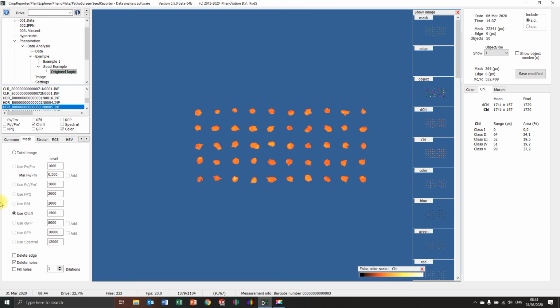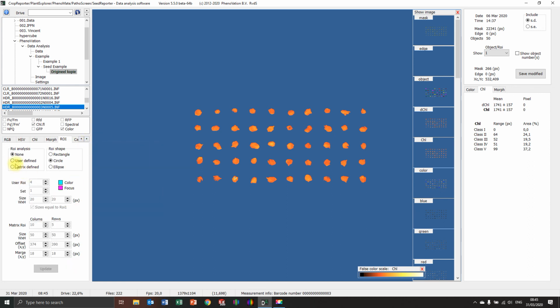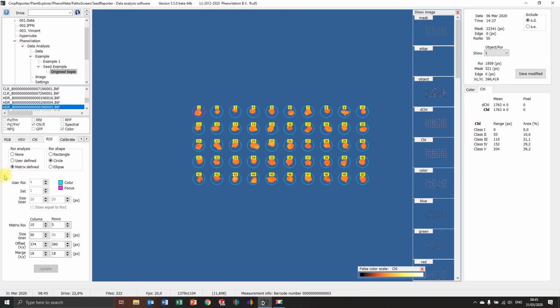So important when you do the analysis, always put one batch of plots or one batch of seeds in one analysis program. So only put these seeds in and analyze it on a certain setting. You can save it. If these are pepper seeds, I don't know exactly, you say save pepper profile or something like that. And if the other one was brassica, you say brassica settings, save it like that, and only use those to analyze the brassica, for example. Well, and now you can do the same thing again. We put the regions on top of it. They're still on top, and then everything is calculated automatically.